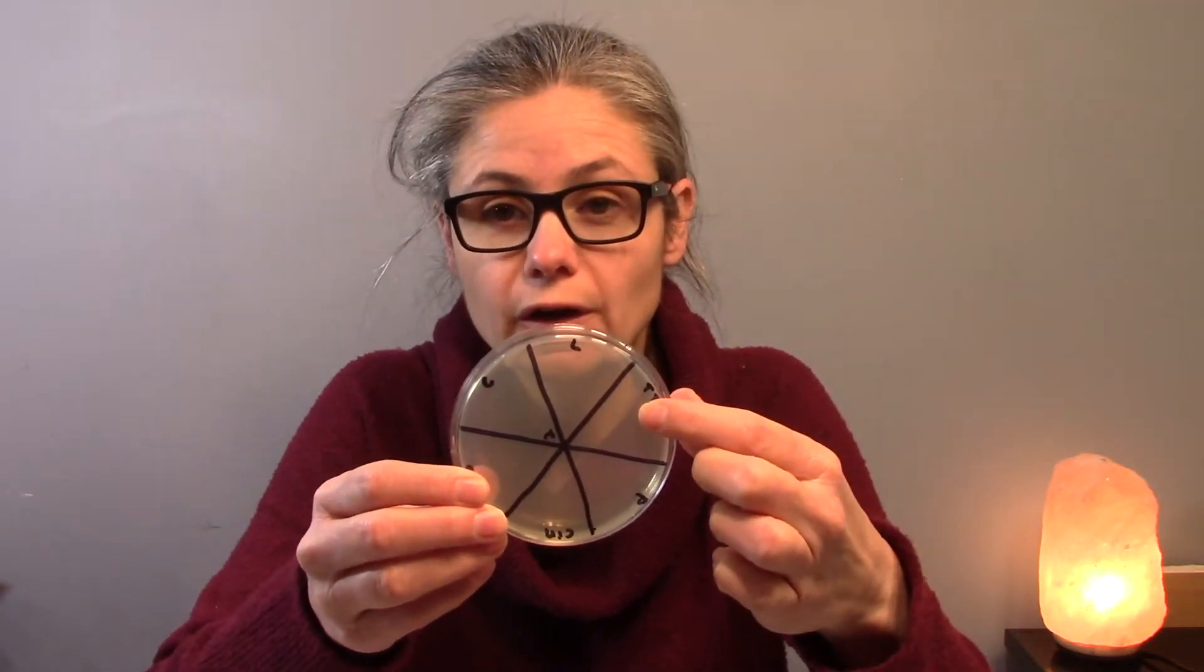I'm going to test lemon, tea tree oil, peppermint, cinnamon, fractionated coconut oil, which is just like a liquid coconut oil. And I'm going to have a control area here where I'm not going to put any sort of essential oil. Let's see what essential oils stop the growth of bacteria.